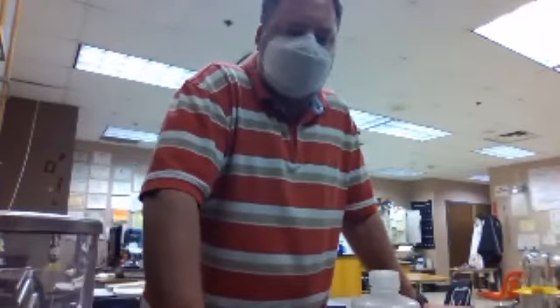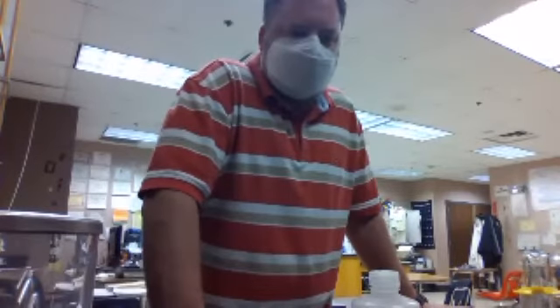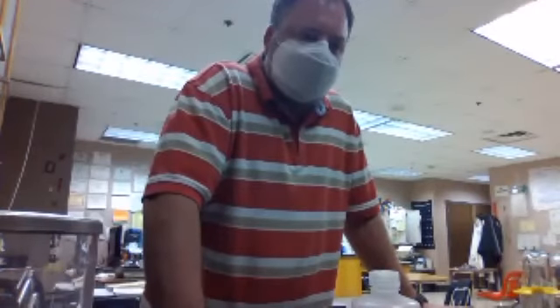What did you guys get for the MA? 7.83. No, that's the milliliters needed. The MA is 0.102. So we took that times the 10, which gives us 1.02. Then we divide it by 0.130 and got 7.84. All right, they did good. What's the volume of the acid? 9.99.